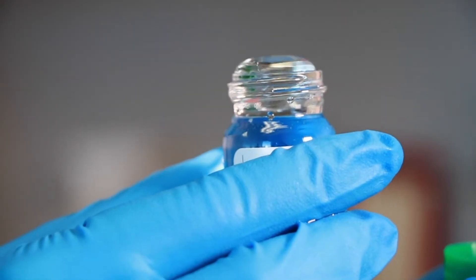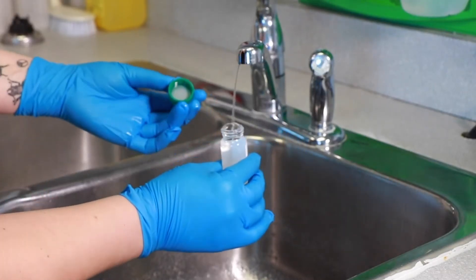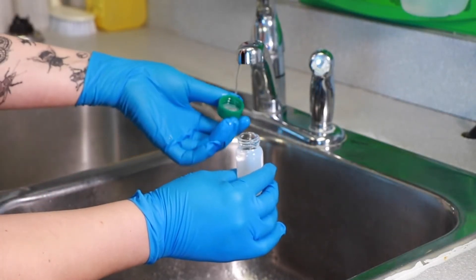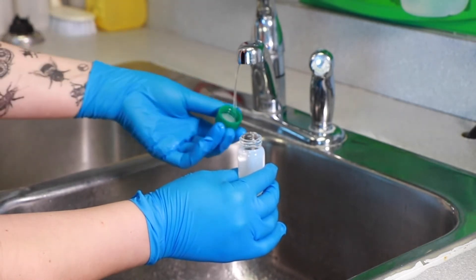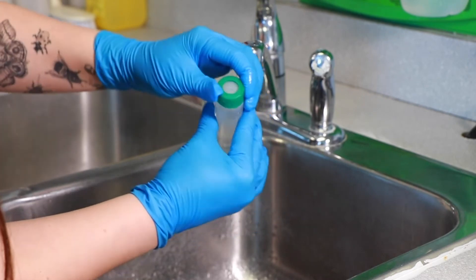This is what the water dome I was referring to looks like. Have a look again at how this is done: dome-shape water at the top of the vial, wet the lid and screw on the top. Tighten the lid firmly, but not too tight because the caps can break very easily.